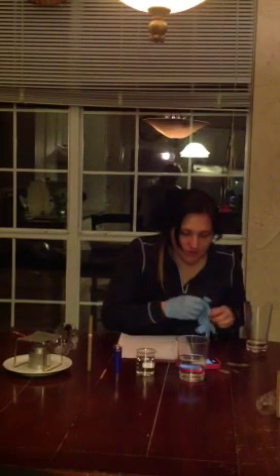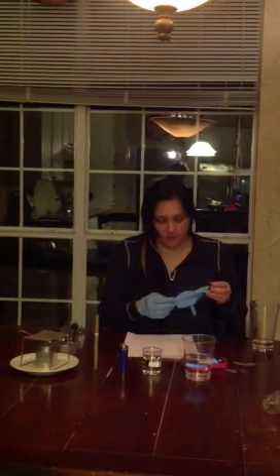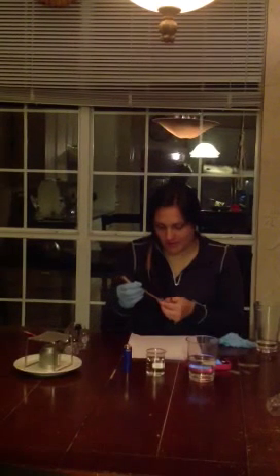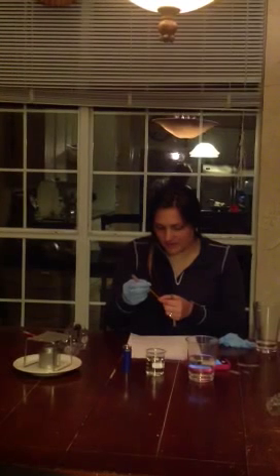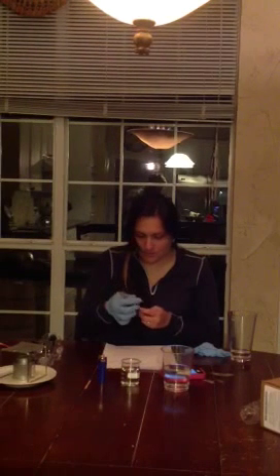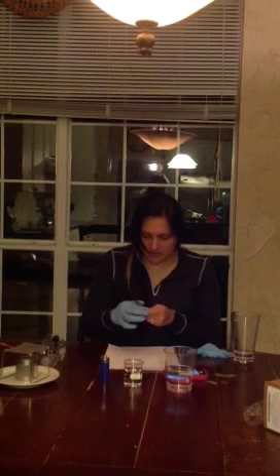Okay, so the first thing that we're going to do is look at the calibration marks on the thermometer, which I had done earlier. And it appears that they are to the tenths place, and so that therefore would be 2 significant figures, I believe. I finished getting my gloves on.